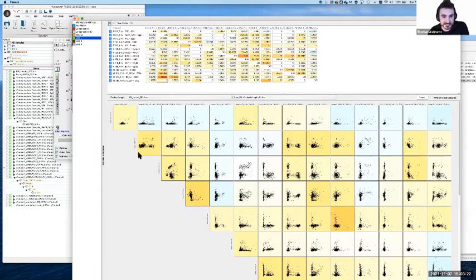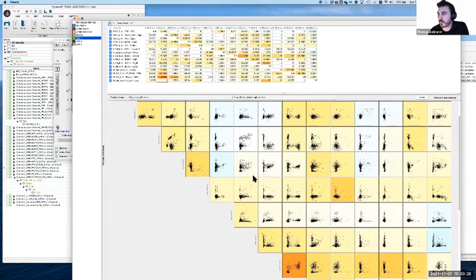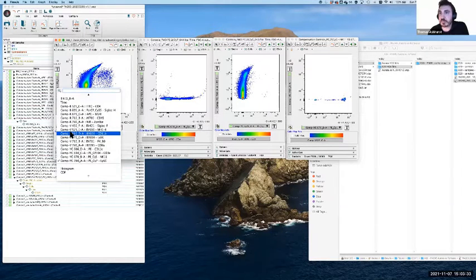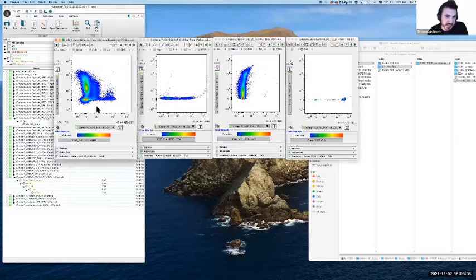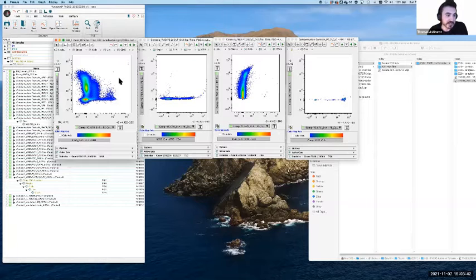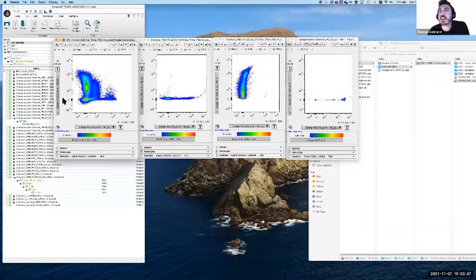Undercompensation is notoriously harder to spot because it won't always stand out in multiple plots. It'll often be much more subtle. In this case, let's just say we had a different plot, CD11b versus NK1.1. That doesn't look outrageous. You can have cells expressing different levels of NK1.1. You can have cells that express low NK1.1, like this middle group here. That's not terribly out of line with what we might expect.